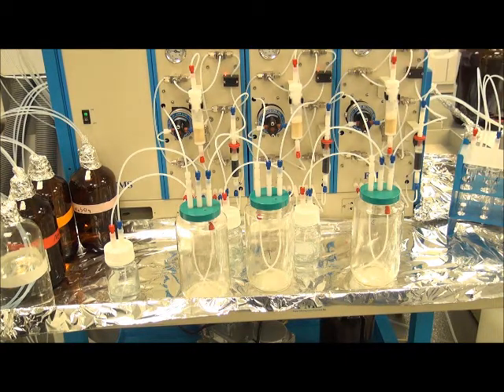And here we go, the bubble sensor tripping and sealed. There's a remaining step where the last of the vacuum will be released and the lines vacuum dried before we enter a stage of solvent exchange, and then begin the bottle rinse and cartridge elution.